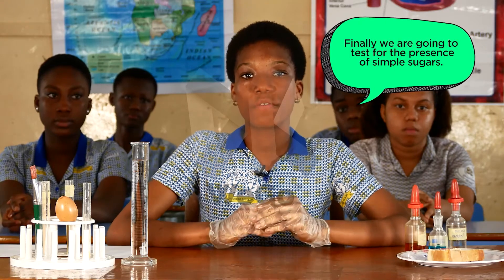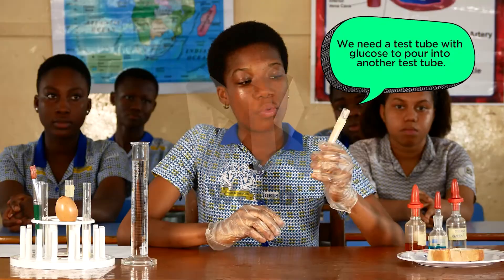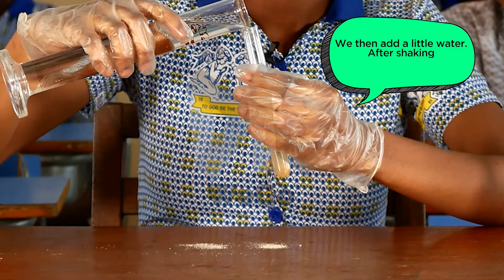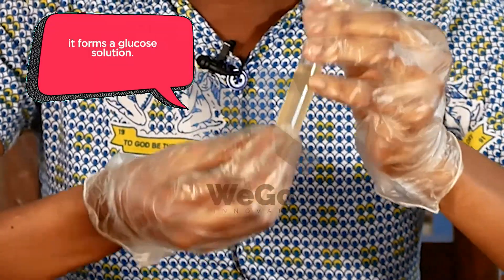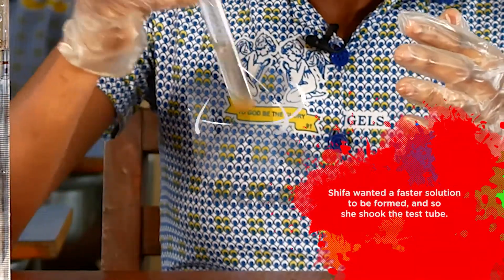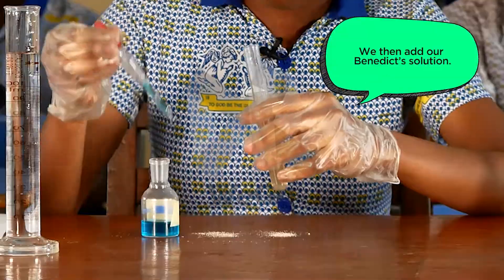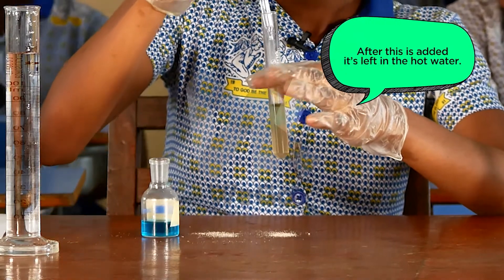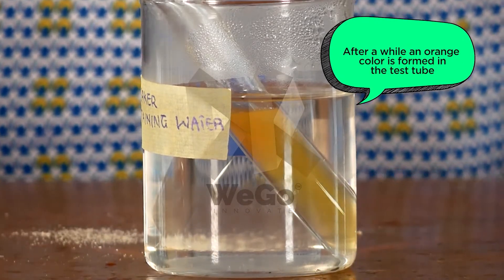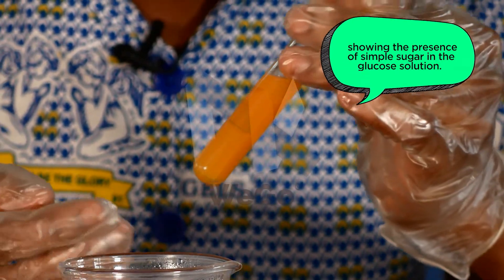Finally, we are going to test for the presence of simple sugars. Glucose is a simple sugar. We pour glucose into a test tube, then add a little water. After shaking, it forms a glucose solution — the water dissolves the glucose. We then add our Benedict solution and place the test tube in hot water. After a while, an orange colour is formed, showing the presence of simple sugar in the glucose solution.